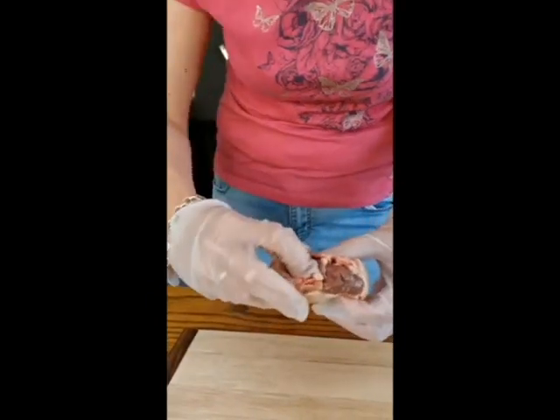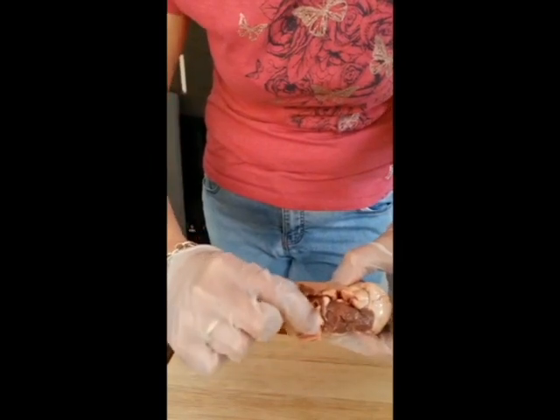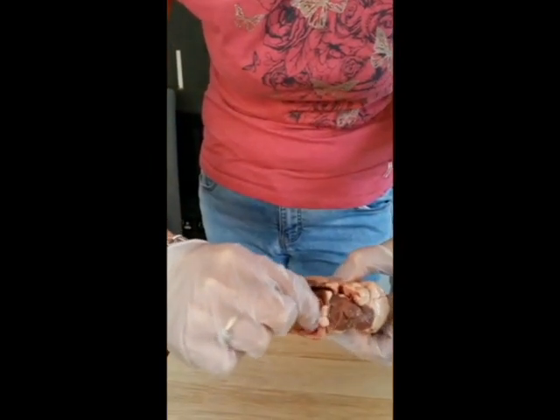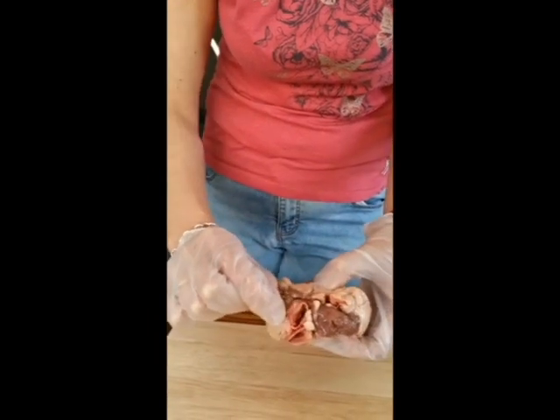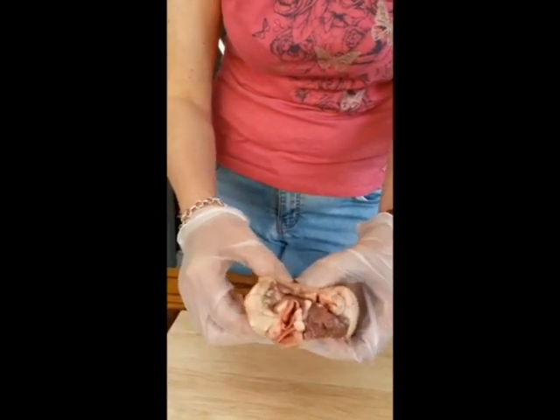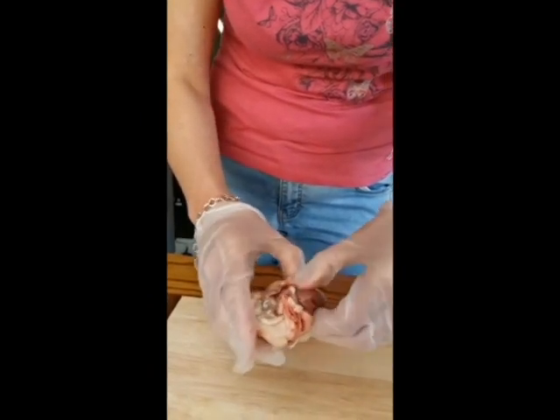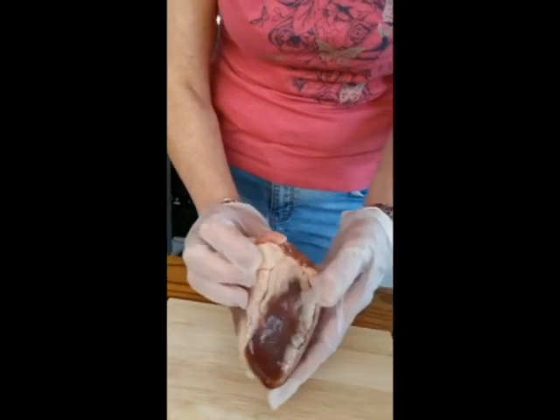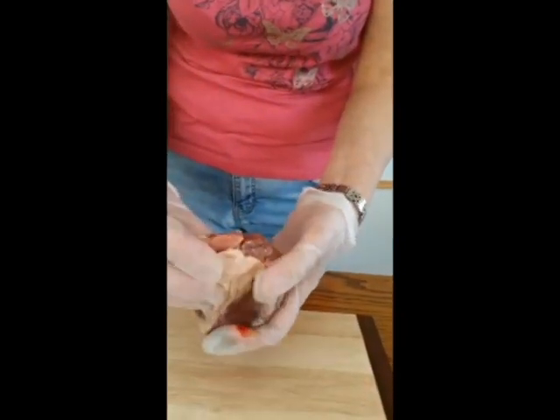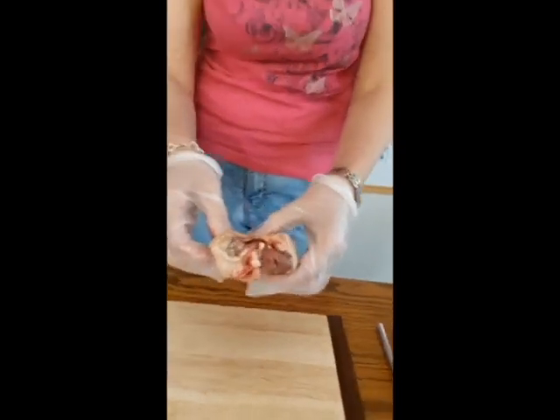Before I cut into it though, you can see these bits here that I'm just pulling on now. These are called blood vessels, and with those you need to know the vena cava, the aorta, the pulmonary artery and the pulmonary vein. So I can see 2 out of the 4, but normally when they cut a heart, because it's come from a butcher's, they try and cut those really short so you can't really see them very well, because at the end of the day they wouldn't look nice on a dinner plate.